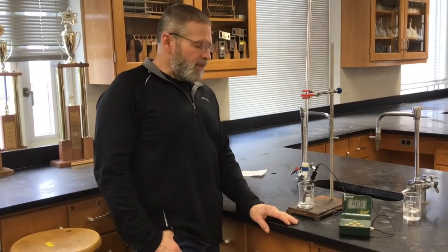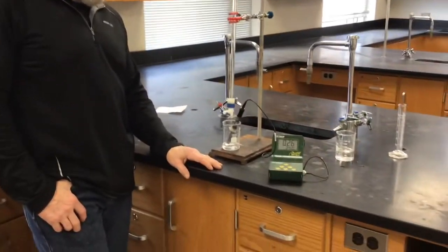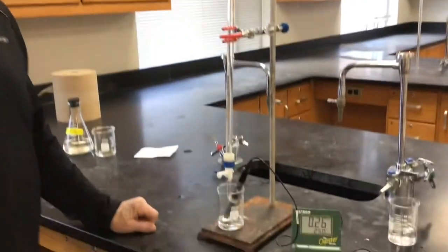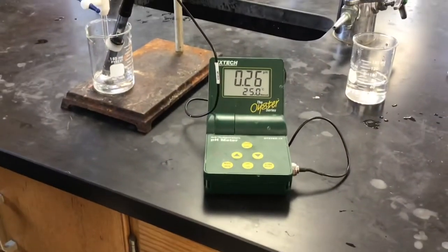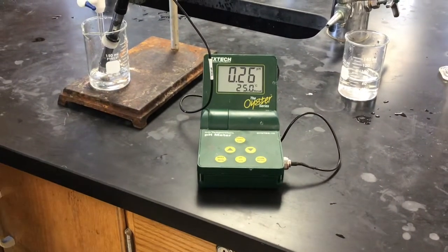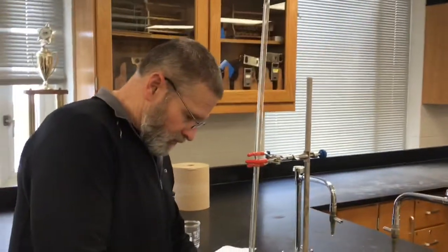This is sample four — strong acid sample four. We're going to titrate it with some sodium hydroxide. At zero milliliters added, there's your pH. We'll start adding sodium hydroxide one milliliter at a time.